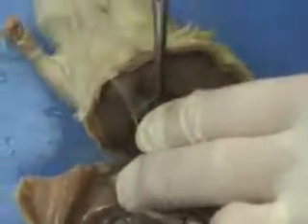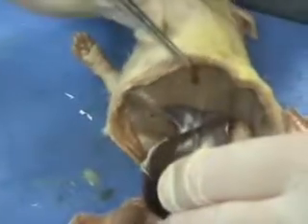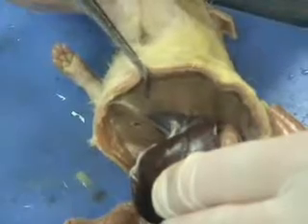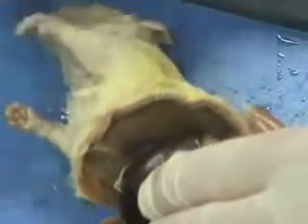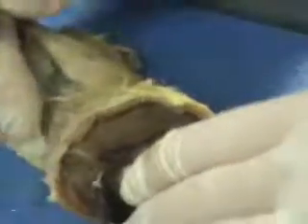The diaphragm is right up underneath the liver, so if I pull some of that clear material back again, you can see a sheet of muscle right here, and that sheet of muscle is the diaphragm to help the rat breathe. And that's really it. The digestive system, circulatory system, all function together to maintain that homeostasis that you read about yesterday.